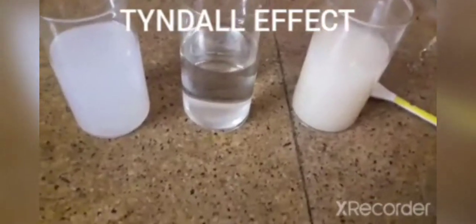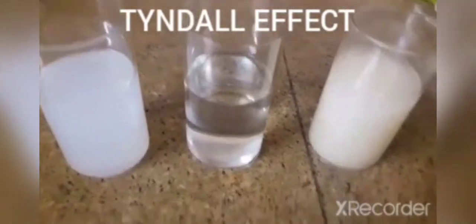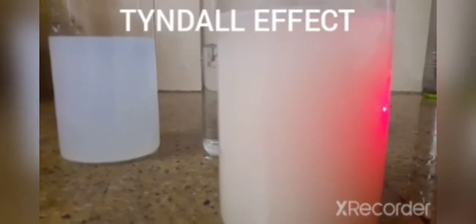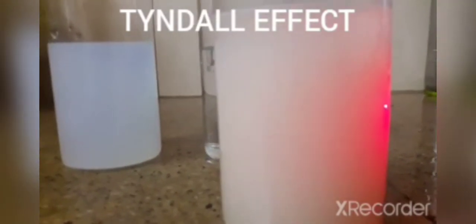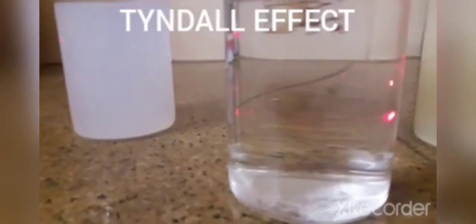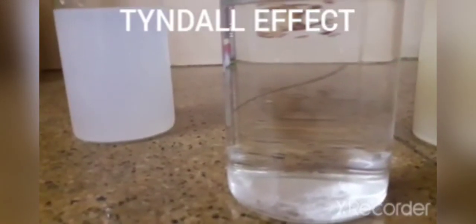So here I have a laser beam and I will pass that through different beakers. The first one is a suspension. So as I put light in here, there is no visible path, so I'll mark it as a no. The second one is clear water solution. So you can barely see the reflection of light on the glass, so therefore we'll mark it as a no.